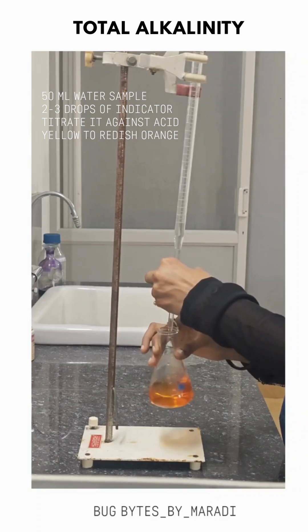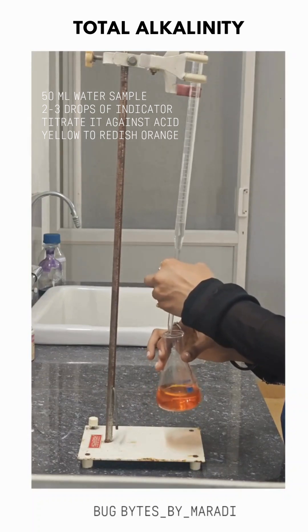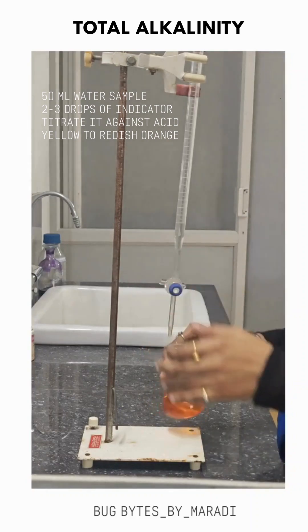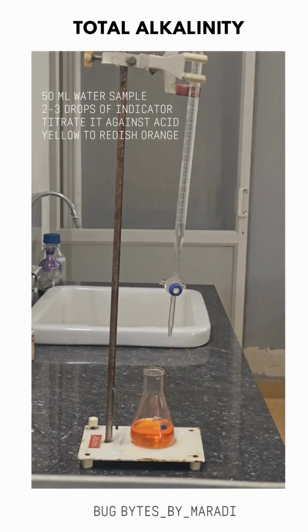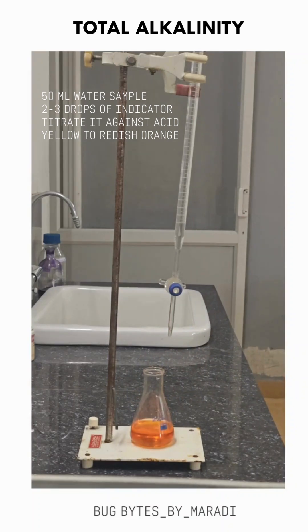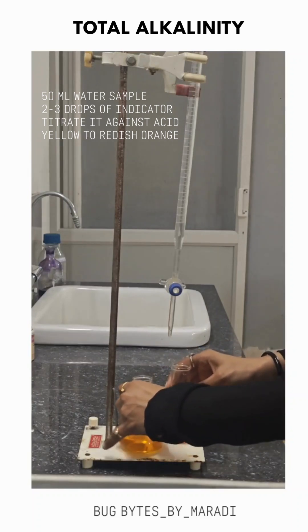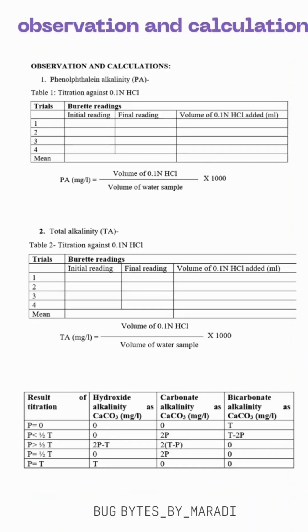The end point tells us that all carbonates, bicarbonates, or hydroxides have been completely neutralized in the water sample. Remember that all three — carbonate, bicarbonate, and hydroxide ions — cannot be present together at the same time in a water sample. Here I've shown the yellow color at the initial stage.